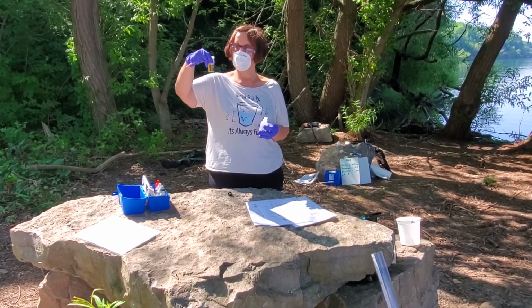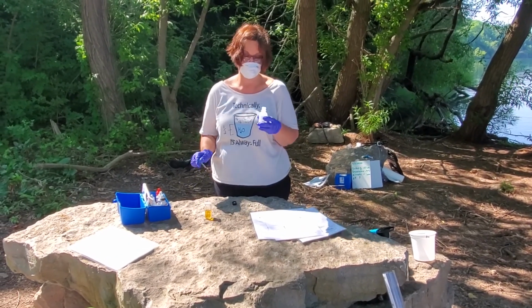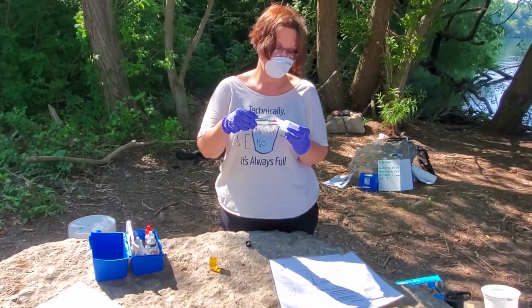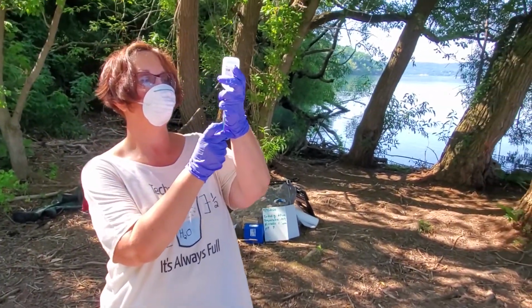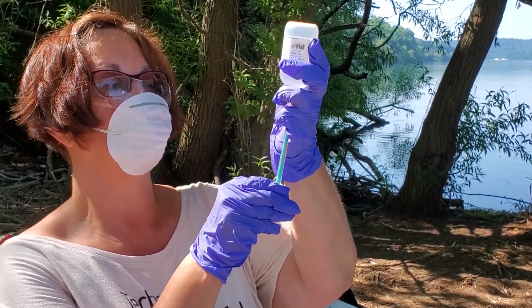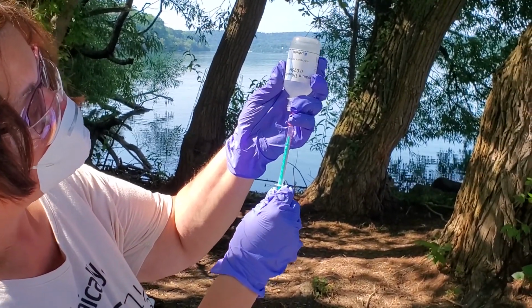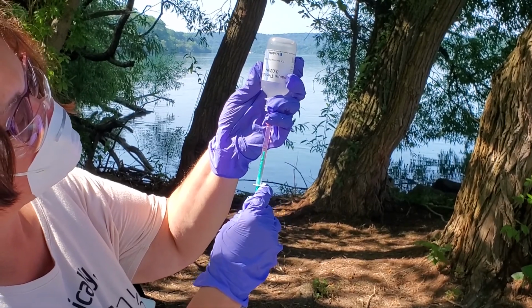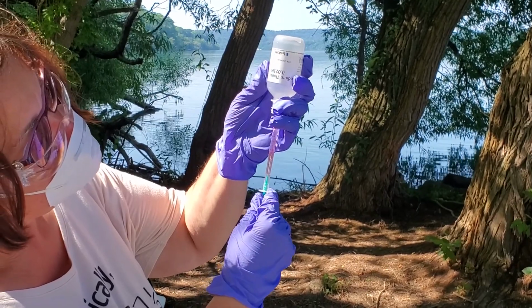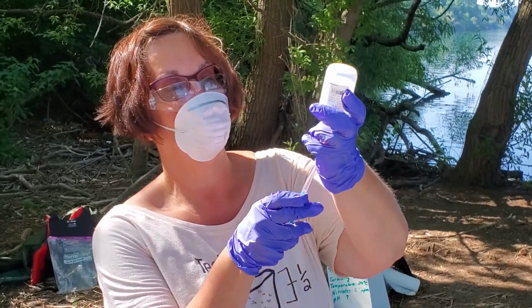I have put 20 milliliters of our solution into the titration bottle, and I'm going to take the titration syringe and insert it into sodium thiosulfate. Then I'm going to pull down the plunger, which is going to allow the sodium thiosulfate to come into the syringe. And we're going to take it all the way down to 0 at the bottom. Right now I have to have it facing towards me so I can actually do this. And we are at 0. Very good.